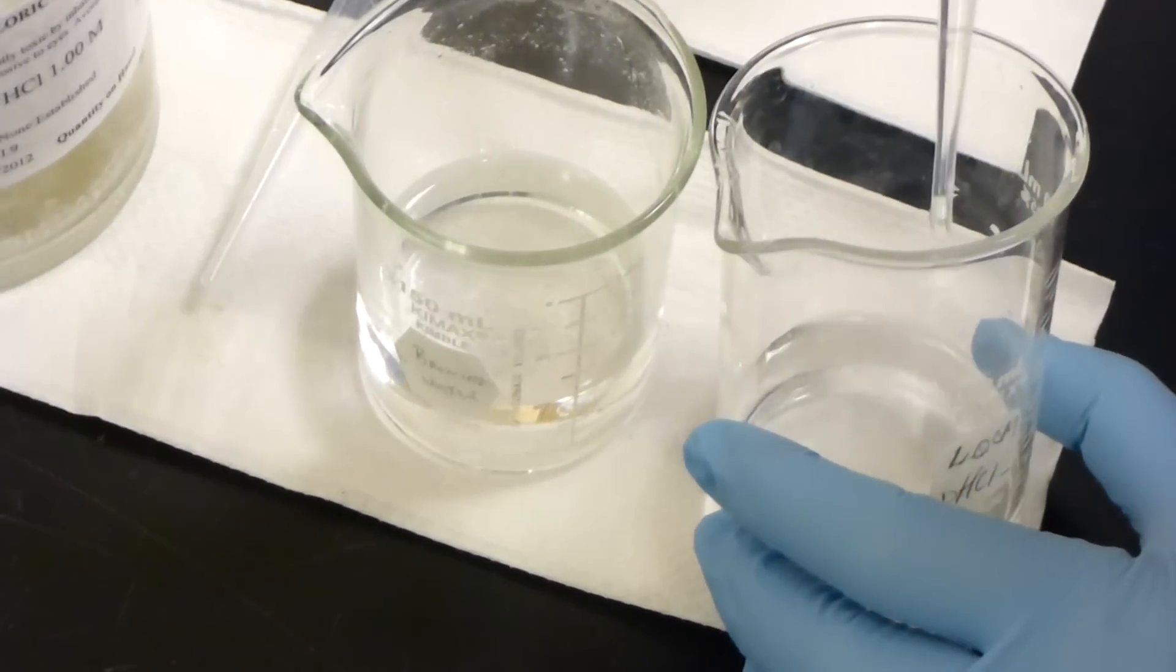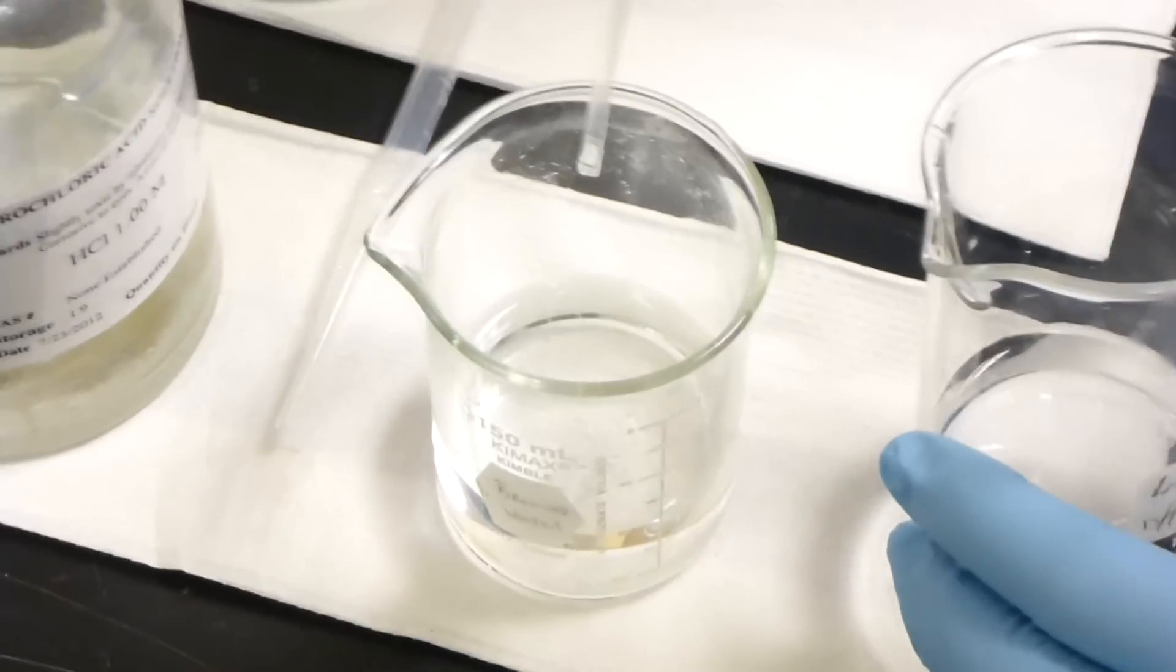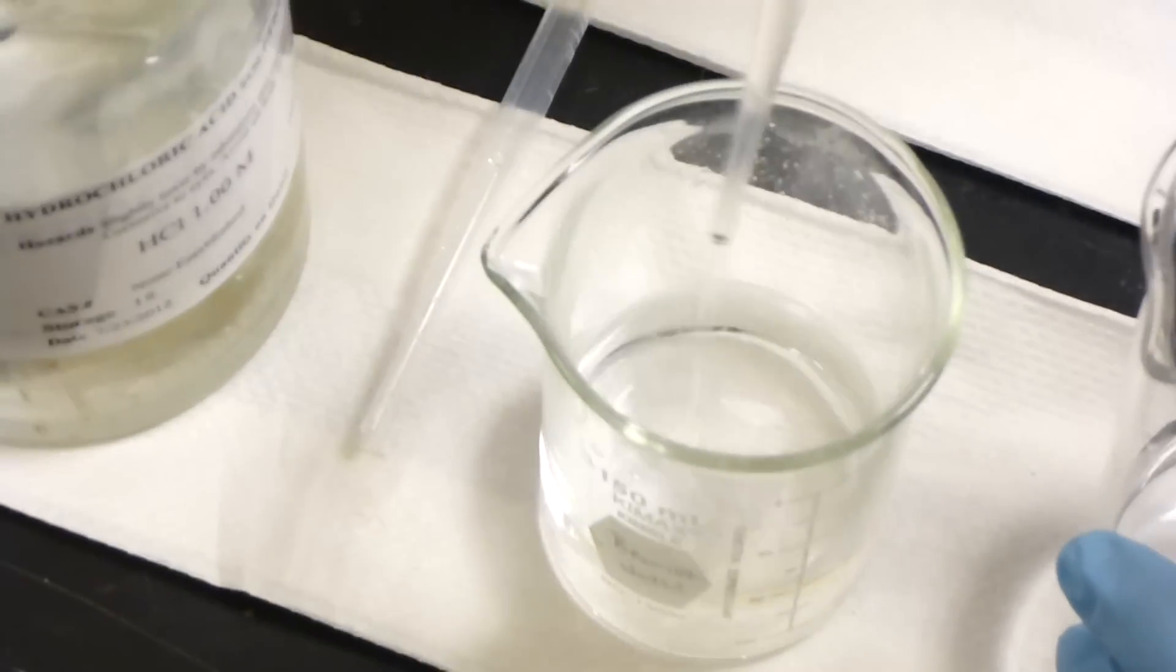Oh, it's much clearer. I see a tall stream of bubbles in there from the bottom to the top.